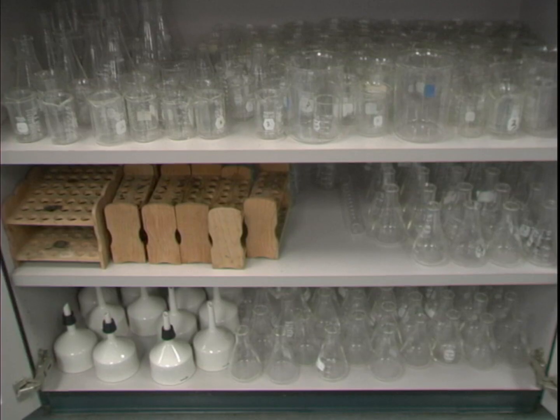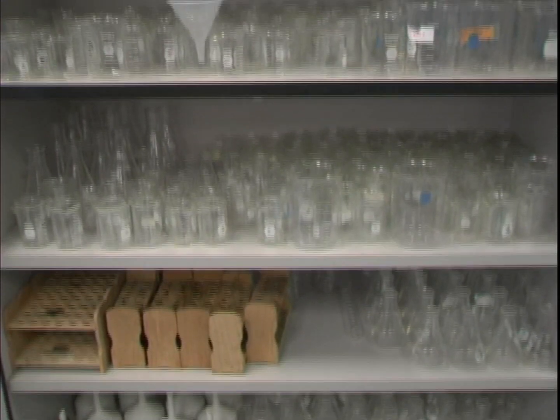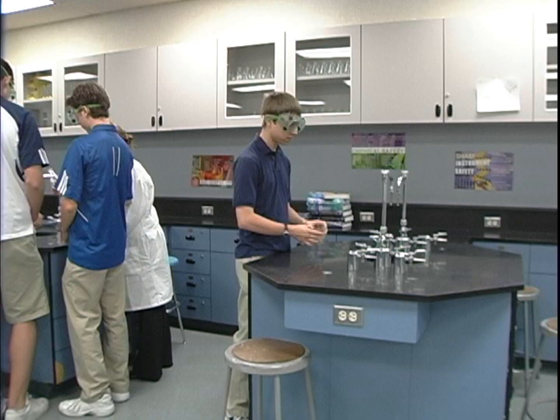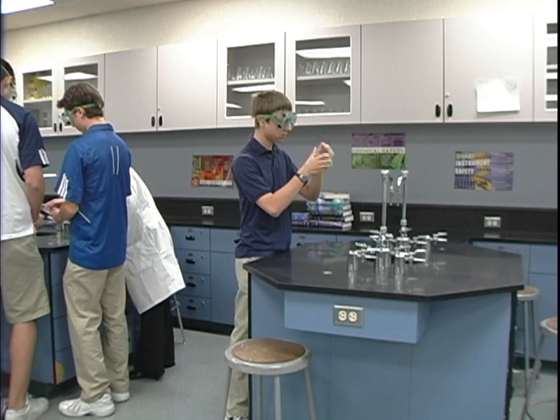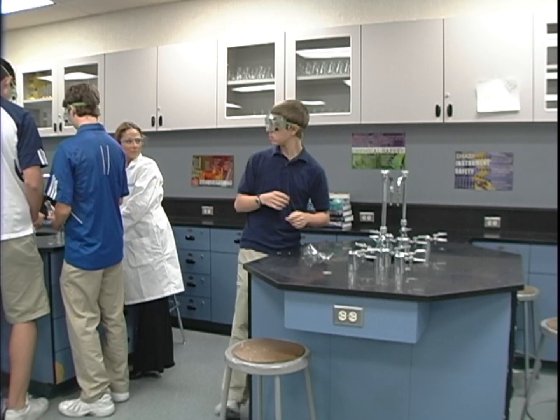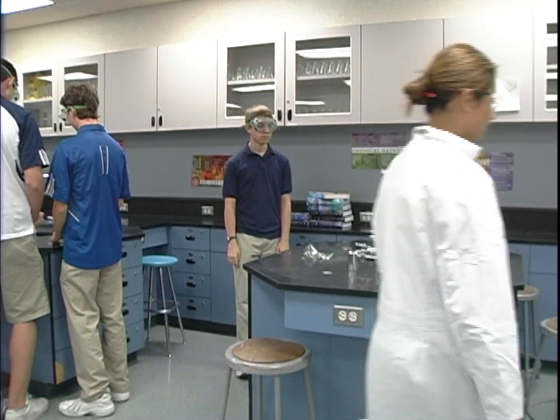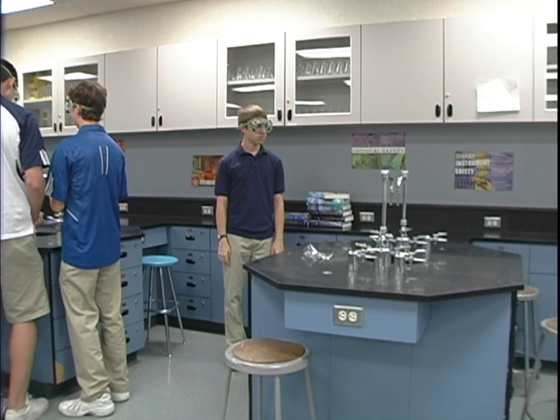Communication is a very important aspect of the lab. Knowing the names and appearance of all lab equipment that you are using will prevent any mistakes from happening. Also, report all broken and chipped glassware to the teacher, and don't pick up broken glass with your hands.